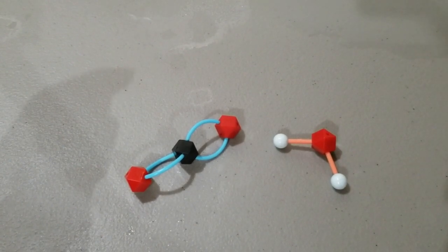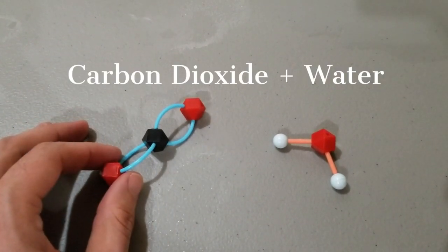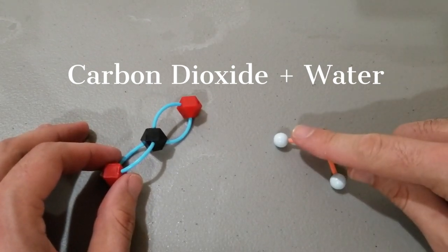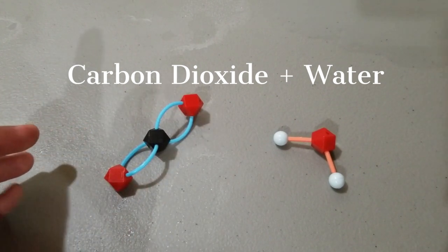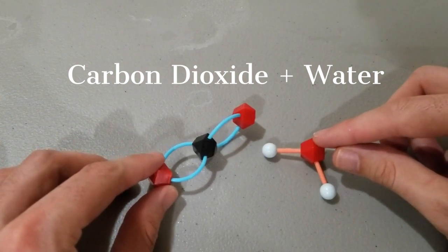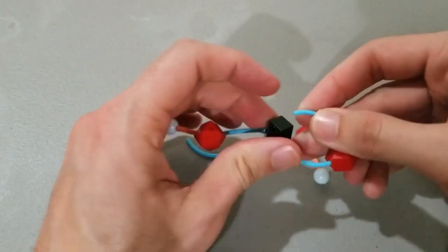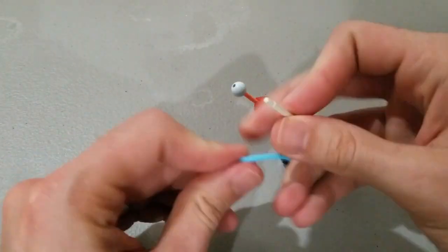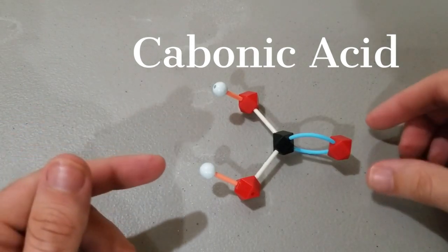So the reason this happens is because what you're breathing out is carbon dioxide, and you're breathing it into the water. Now carbon dioxide is not an acid — you don't have acid in your breath — but the carbon dioxide reacts with the water to make carbonic acid.